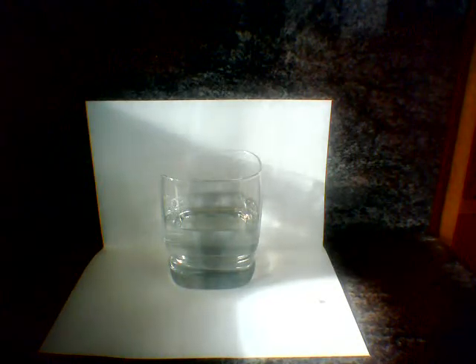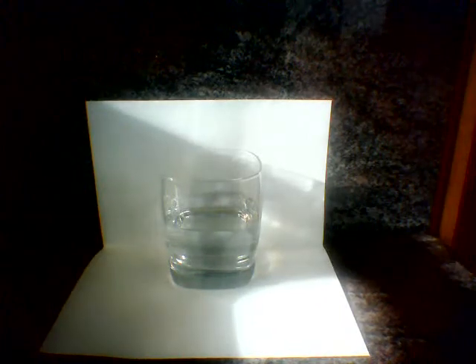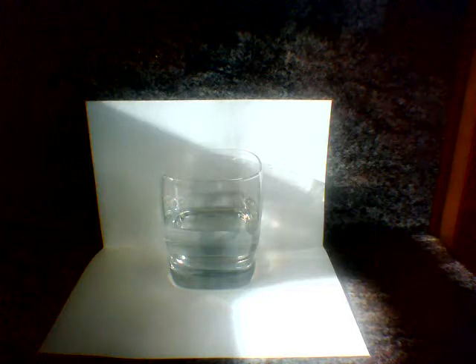Welcome to the Chemistry Question. Jordan here, and today I'm going to do another demonstration using phenolphthalein. This time I'm going to drop just a very small amount of sodium metal into some water with phenolphthalein, so we can see the change as the water becomes basic.